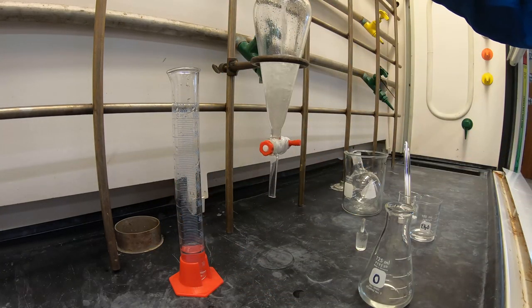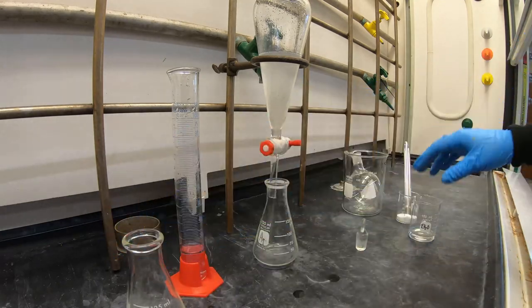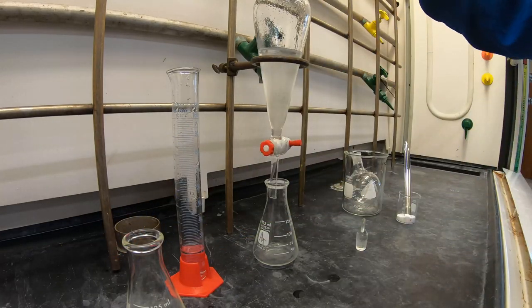Now return the aqueous layer to the separatory funnel. Rinse with fresh ether and separate once again.